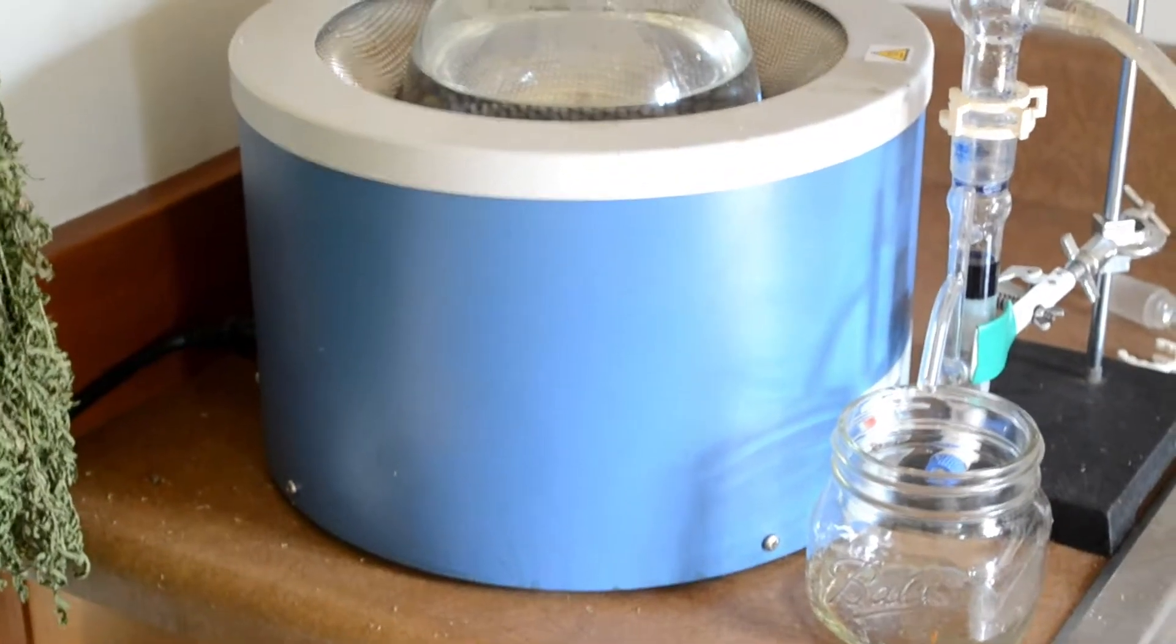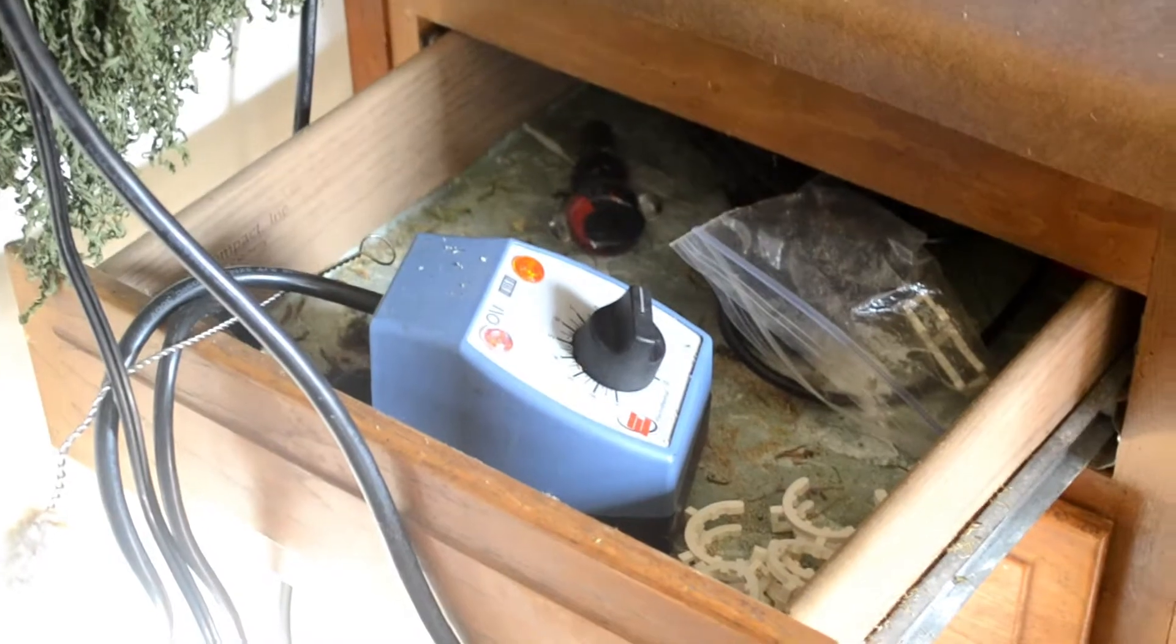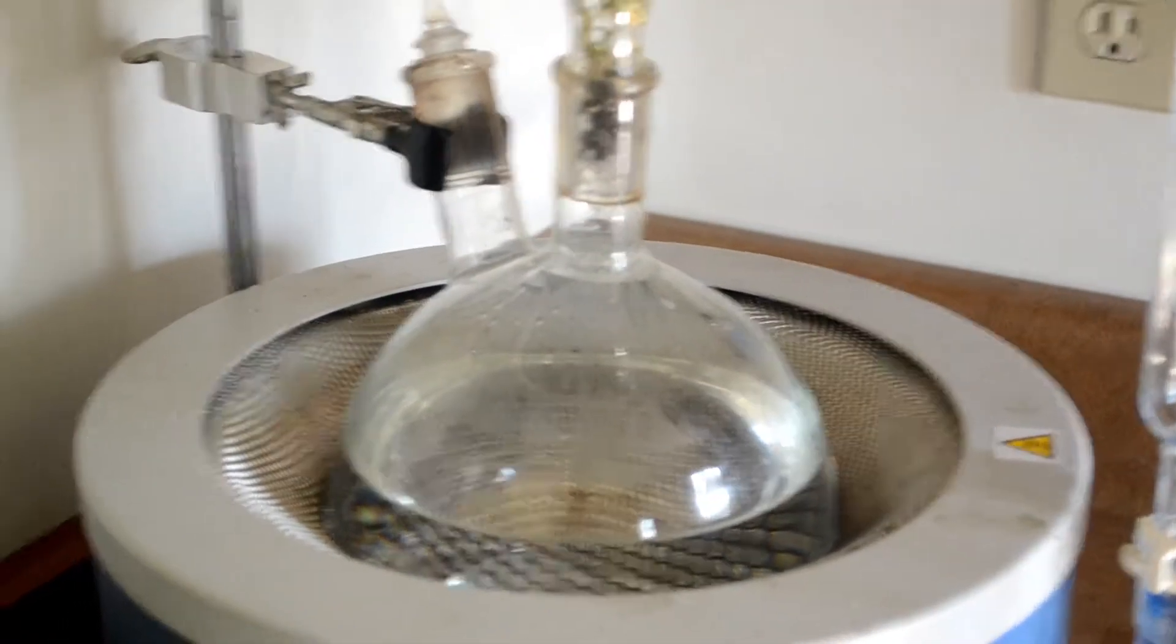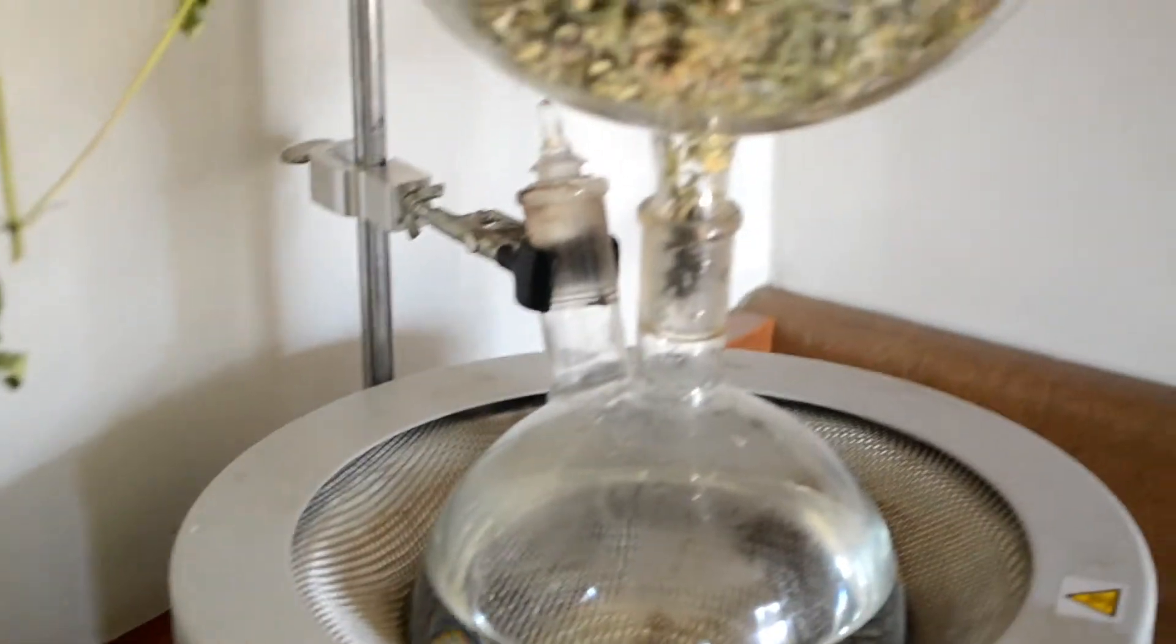Got a few new pieces for my still, new heating mantle with power adapter. A lot better control, serious quick heat up and slow down, cool down.